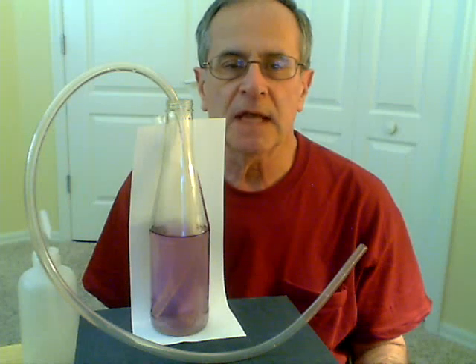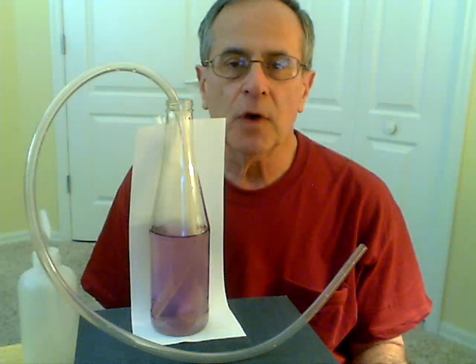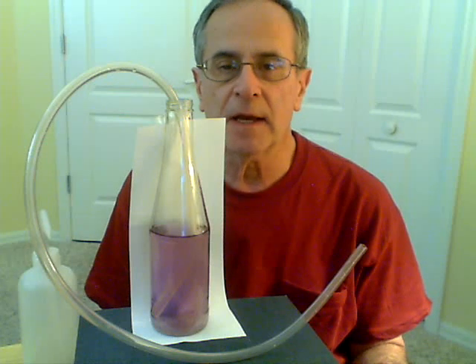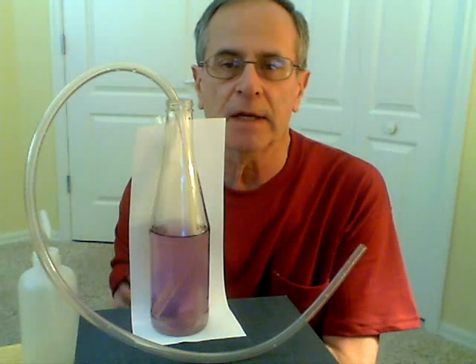Today I'm going to demonstrate that exhaled breath contains carbon dioxide. As many of you know, carbon dioxide is a weak acid. It reacts with water to produce carbonic acid, which then dissociates into the hydrogen ion and the bicarbonate ion.